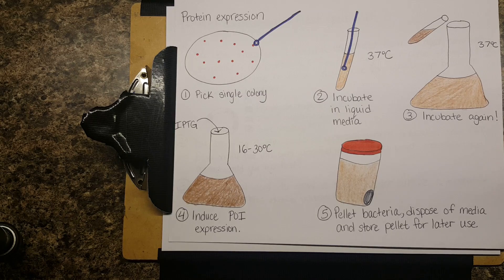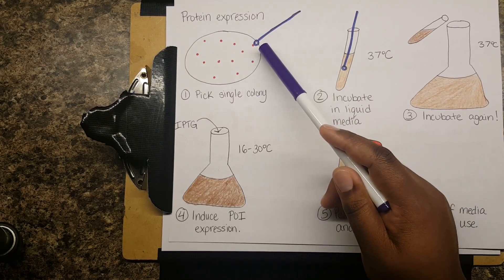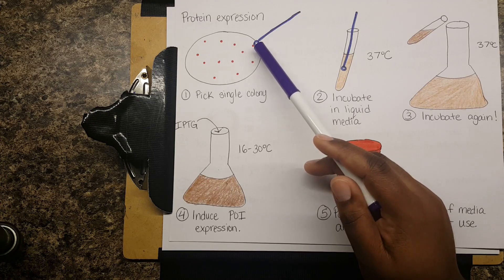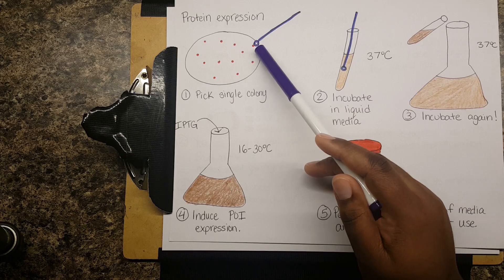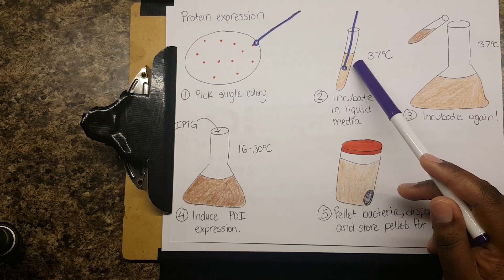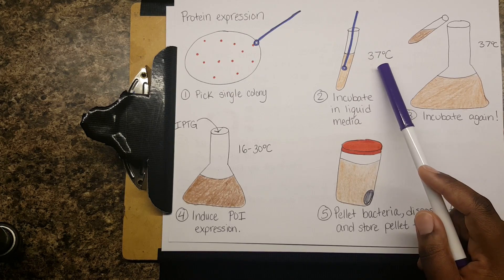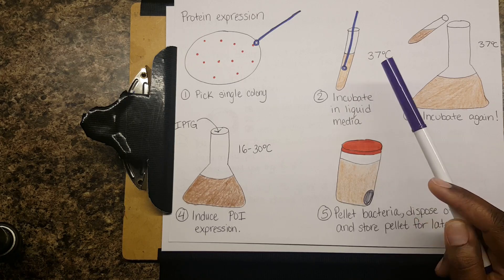This is the scheme for actually expressing a protein. After transformation, you use a sterile loop or pipette tip to pick up a single colony — you want bacteria all expressing the same thing, so that any mutations are at least consistent. You add that single colony to a small test tube containing liquid growth media with amino acids, salts, and everything bacteria need. You incubate that at 37°C, usually overnight.